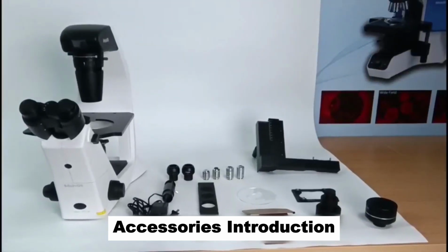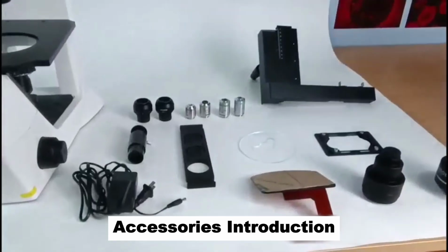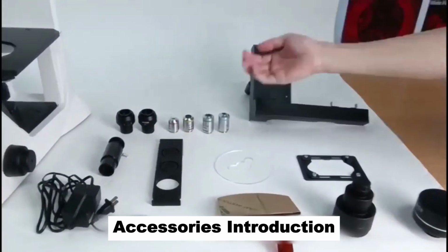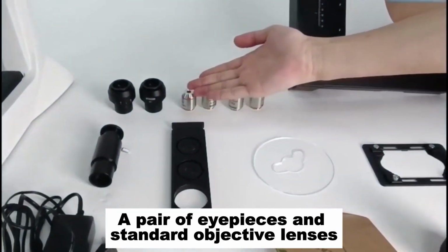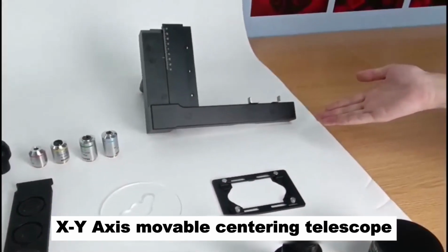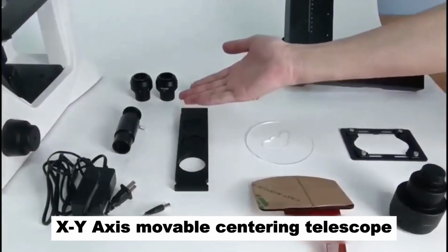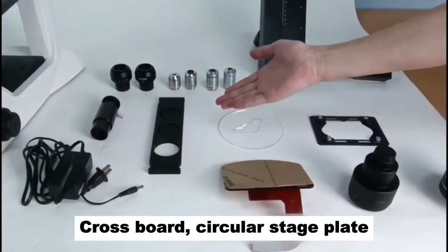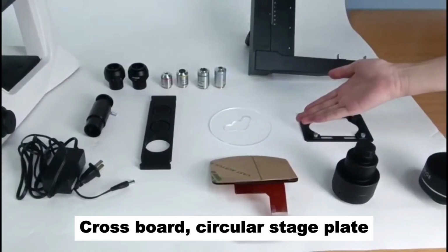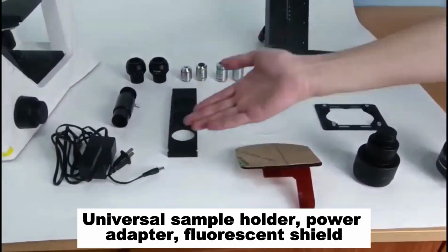Accessories introduction. A pair of eyepieces and standard objective lenses. XY axis movable centering telescope. Crossboard circular stage plate. Universal sample holder, power adapter, fluorescent shield.